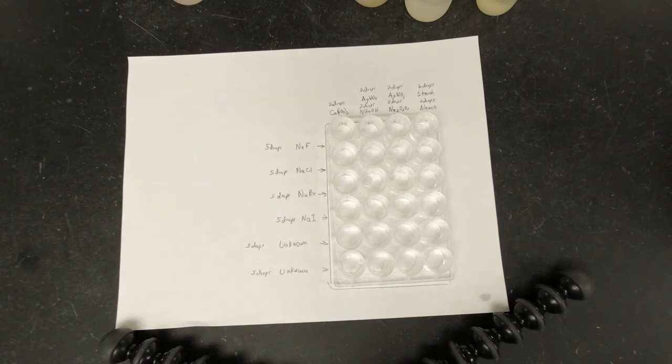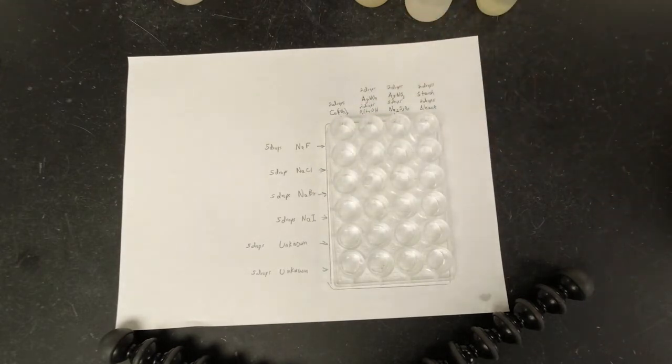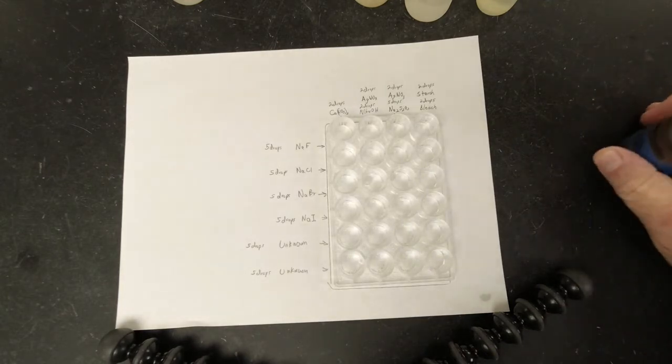All right, so in our second and third reagents, we both need silver nitrate. Now, silver nitrate is mildly toxic, so you don't want to get it on your skin. You certainly don't want to eat it. We have to store it sealed from light, because the silver nitrate will degrade, and it's expensive, as you can imagine.